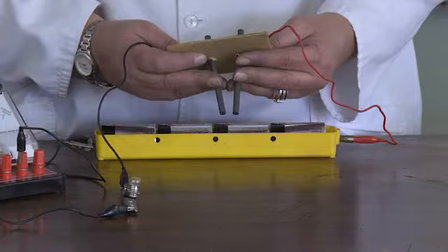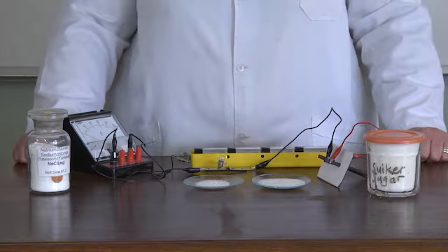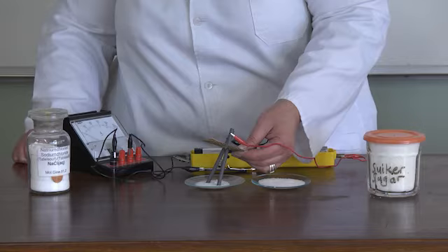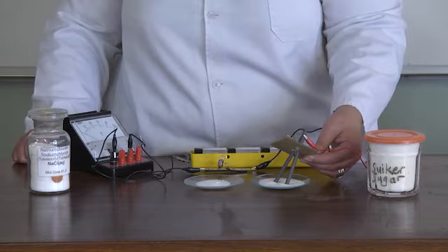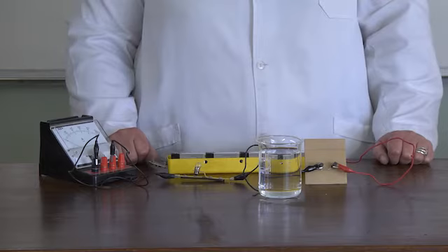Start by first testing the conductivity of solids. Place enough dry sodium chloride in a watch glass and sugar in another watch glass. Place the electrodes in the sodium chloride while ensuring that the electrodes only touch the dry crystals and not the bottom of the watch glass. Observe what happens — no current is flowing. Place the electrodes in the sugar while ensuring that the electrodes only touch the dry crystals and not the bottom of the watch glass. Observe what happens — no current is flowing.